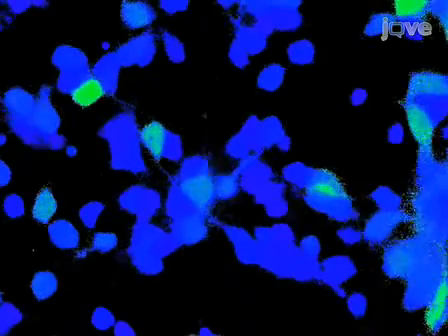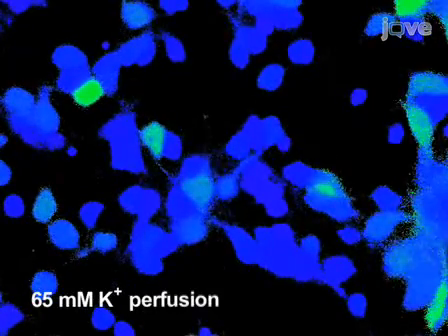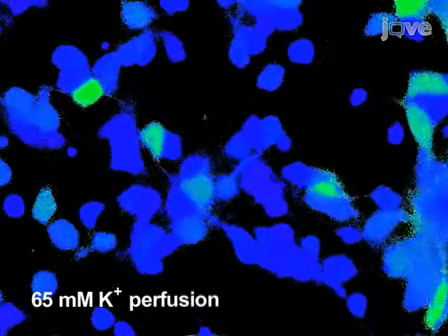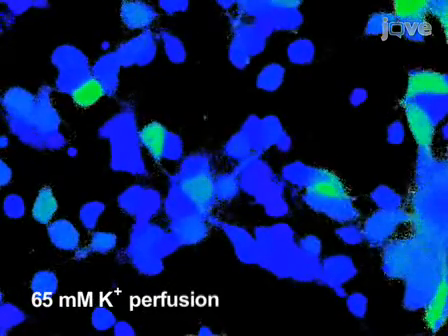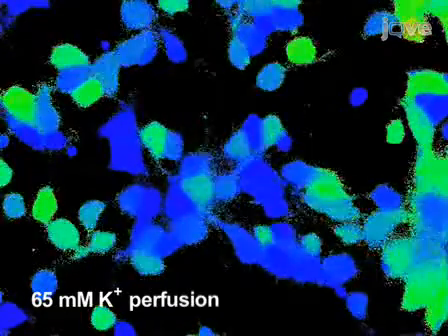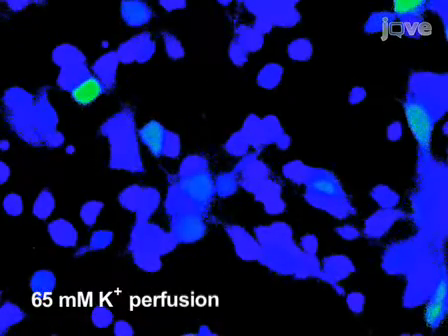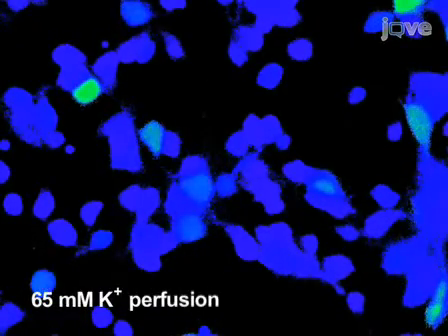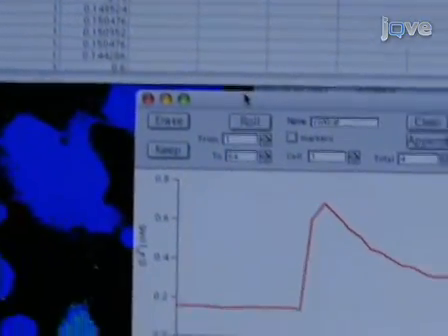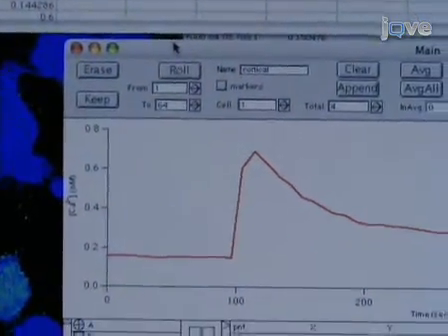When testing the calcium imaging system, it is often useful to use high concentrations of stimuli that will cause an intracellular calcium rise, such as 65 millimolar potassium. Once the experiment is complete, proceed with results analysis.